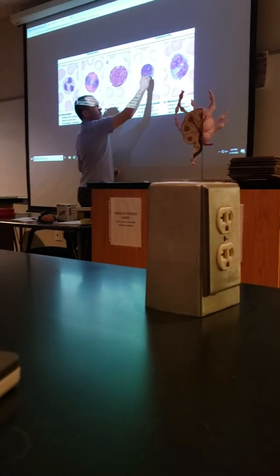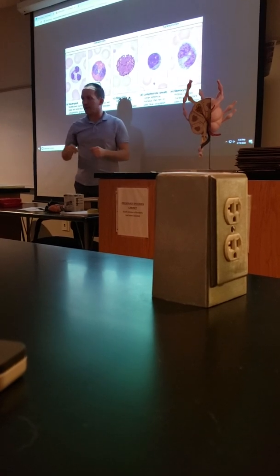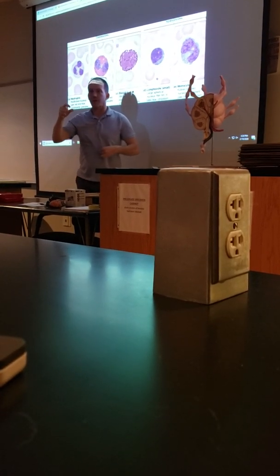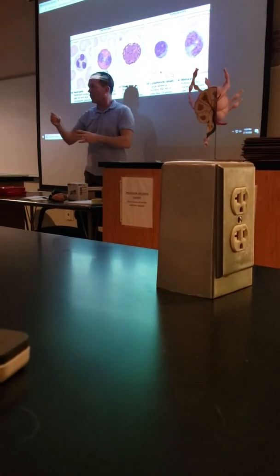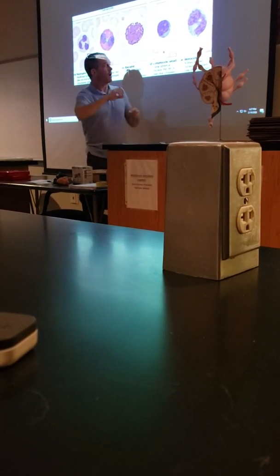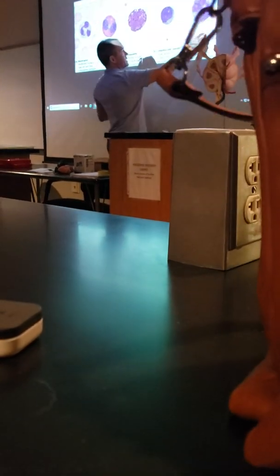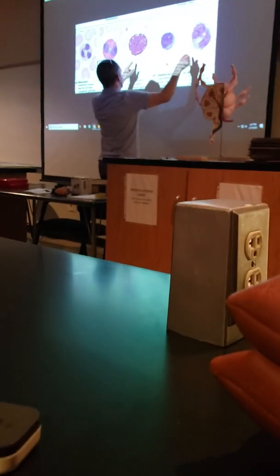This one, the basophil and the lymphocytes, sometimes can be confusing, but look for this little clear patch on lymphocytes, because you're always going to see that. They don't have granules, and their nucleus doesn't take up the whole cell, so you get to see like a little crescent. Basophils are generally just completely dark, and they're not really to scale. Look at how big this is compared to these blood cells compared to that guy.